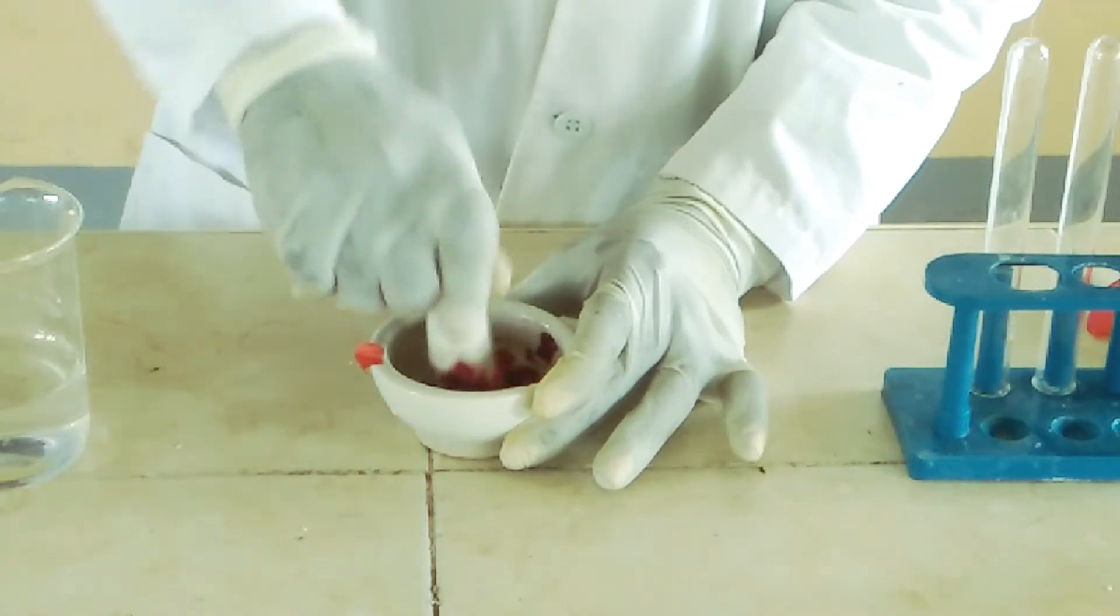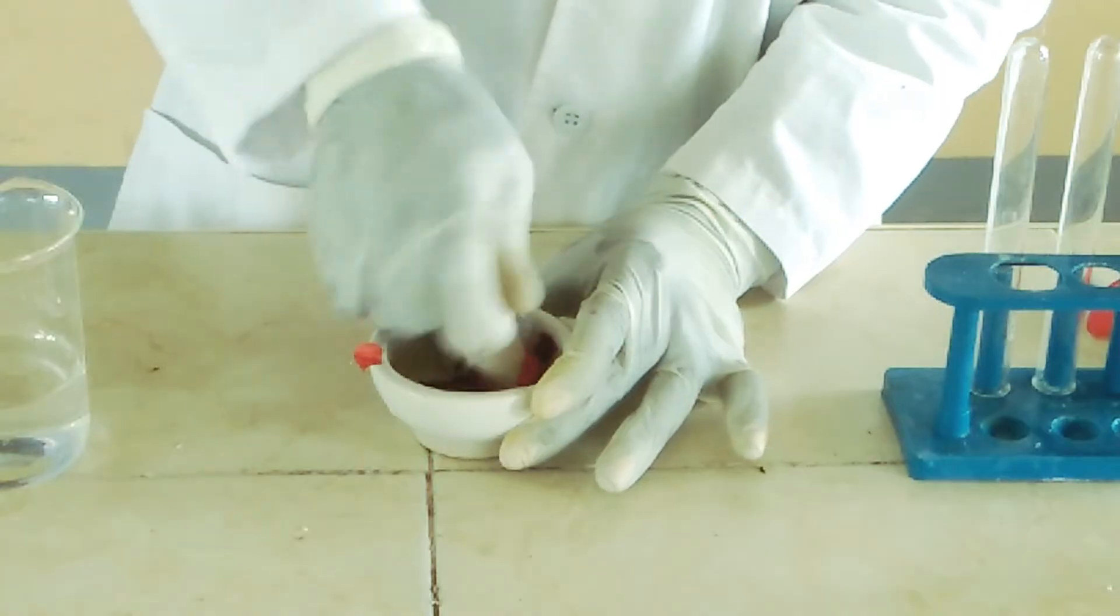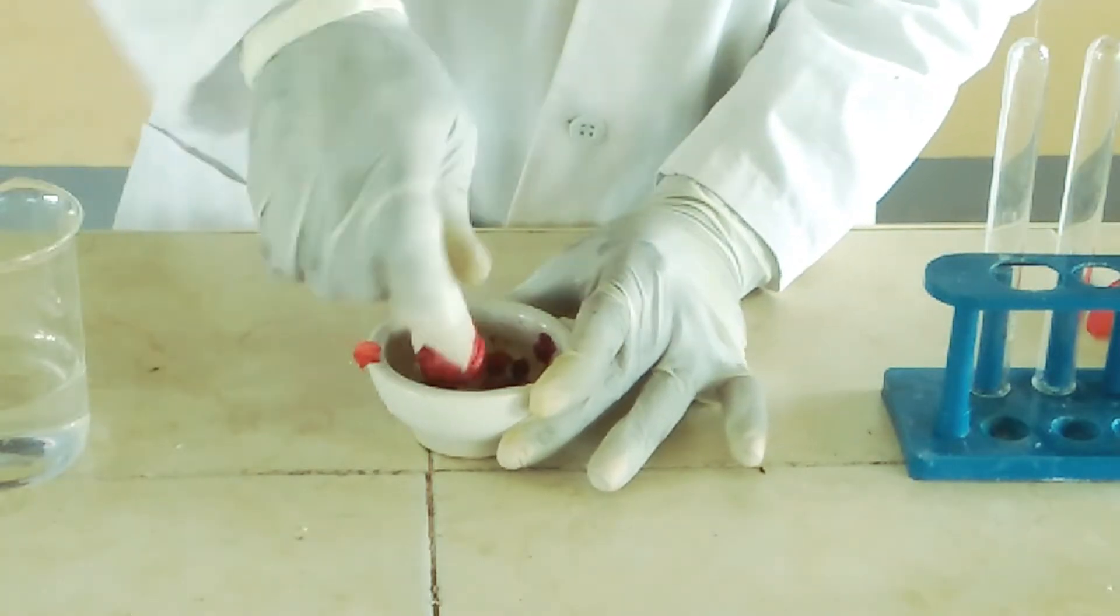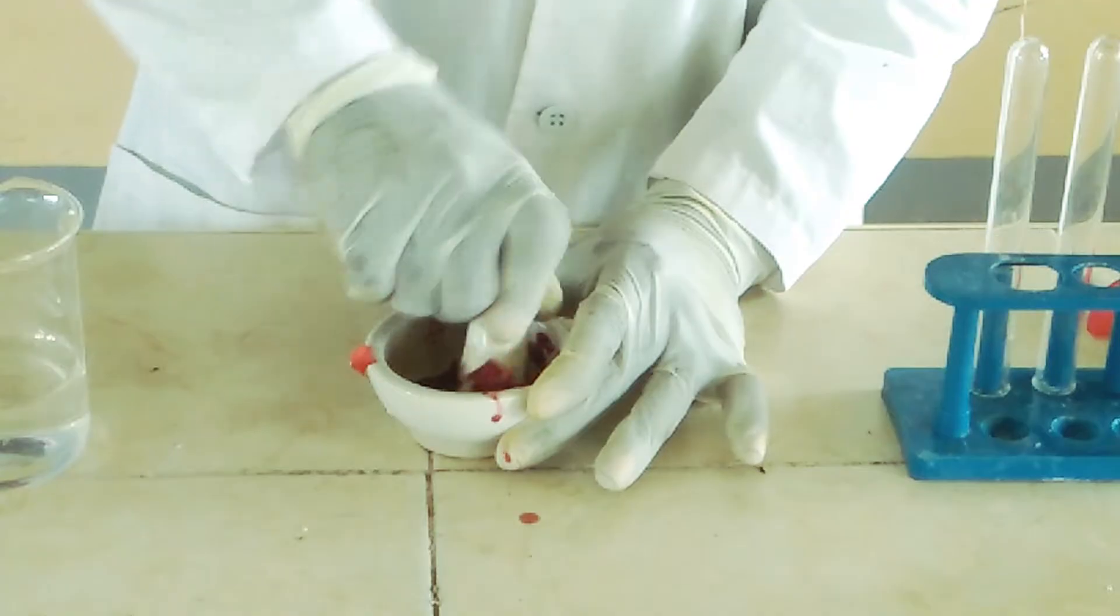We're using this propanone because it can dissolve most of the organic substances. Water will not be able to do that, so it's best to use propanone.